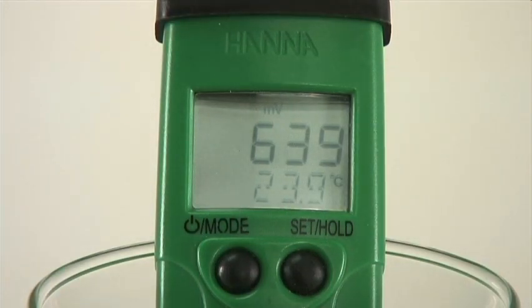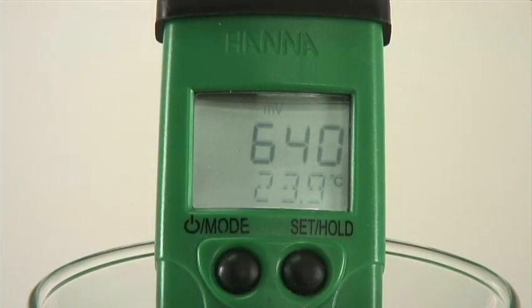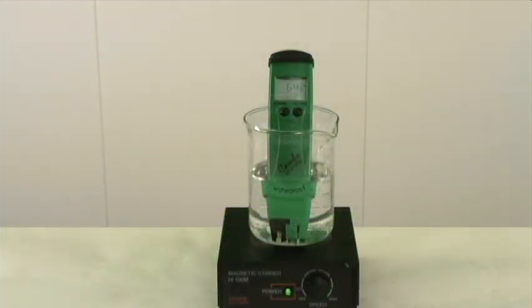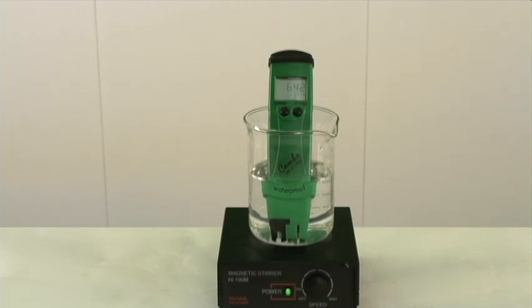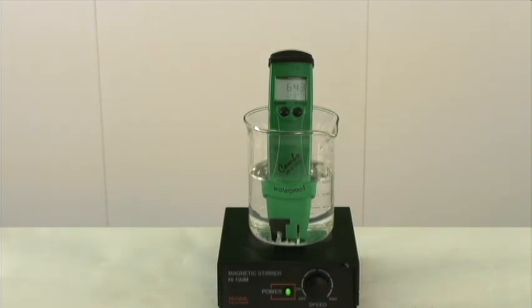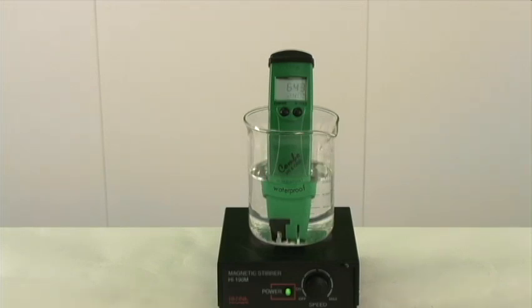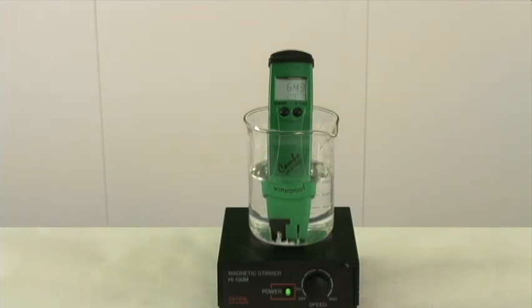So we have an ORP of around 640. The ideal millivolt reading for pool sanitation is around 700 or greater. Therefore, because the pH was higher, the millivolt reading was lower than 700. The chlorine was not effectively sanitizing.